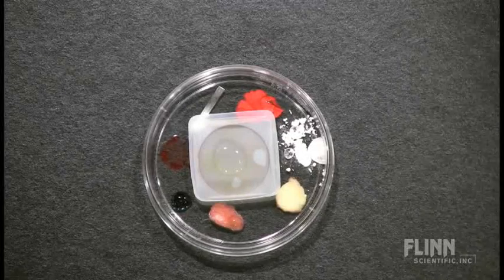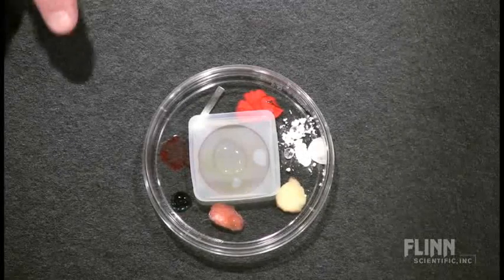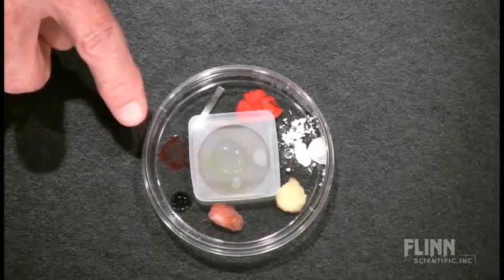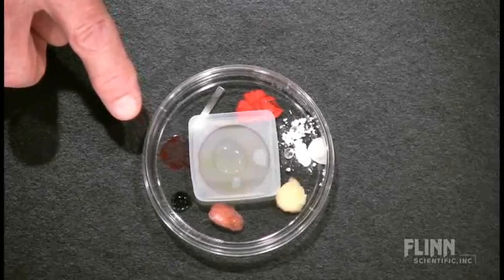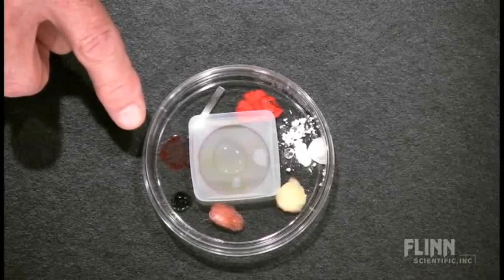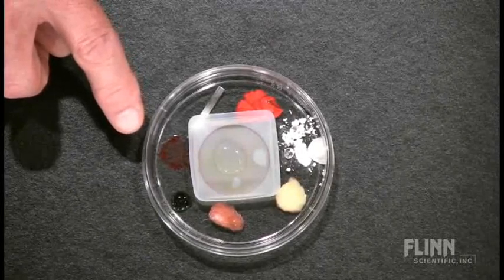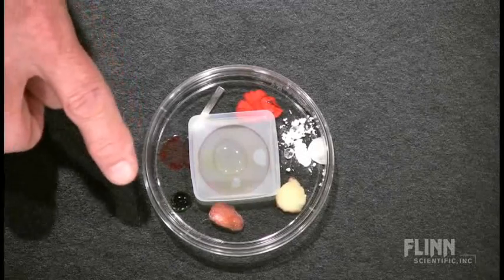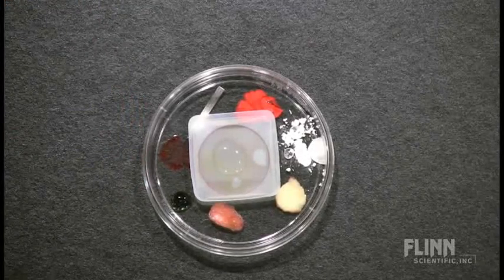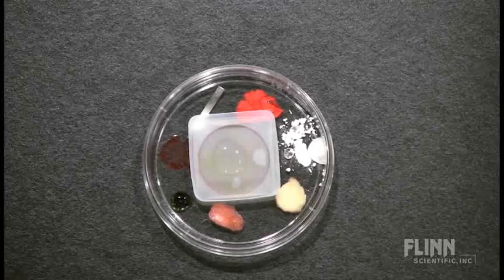We can probably begin to see a little bit of color change taking place with the universal indicator. It's gone from its normal green color to more of a red color. We'll begin to see a little bit of change in the bromothymol blue solution as this process takes place as well.